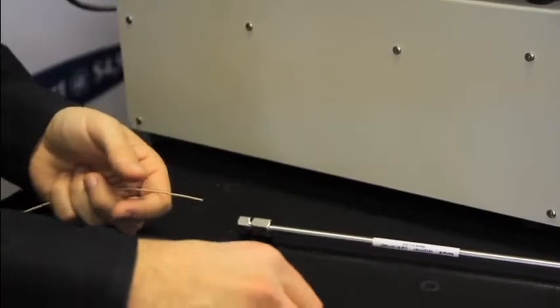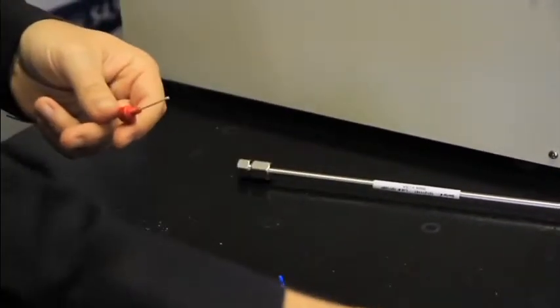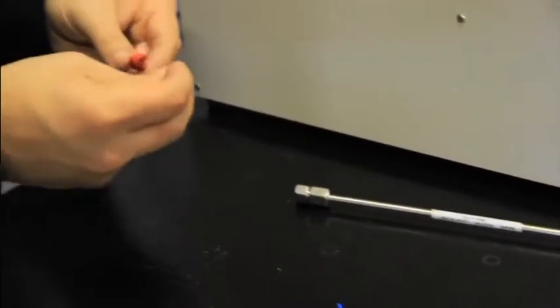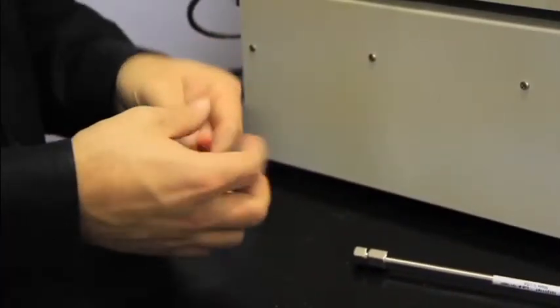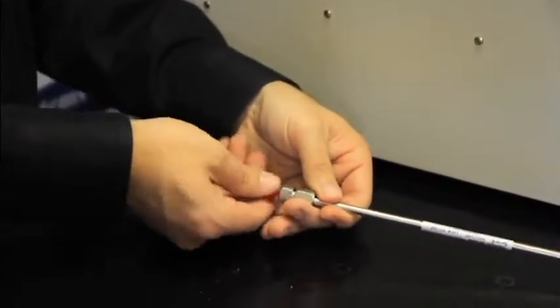We're going to connect from the outlet of the column. Again, save these plugs for storage, and repeat.